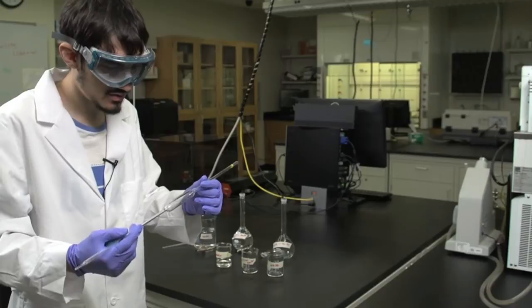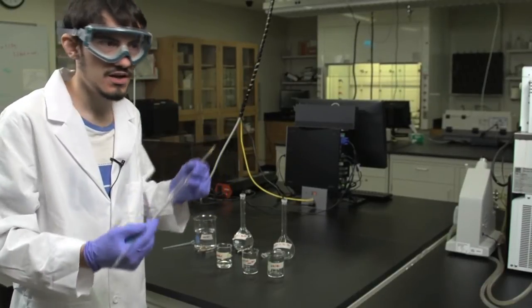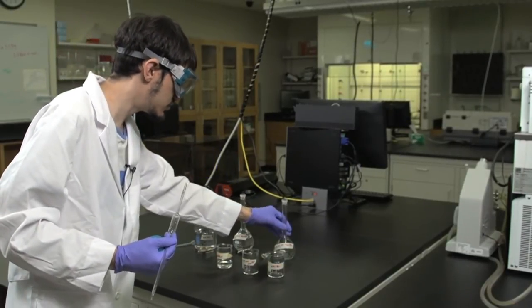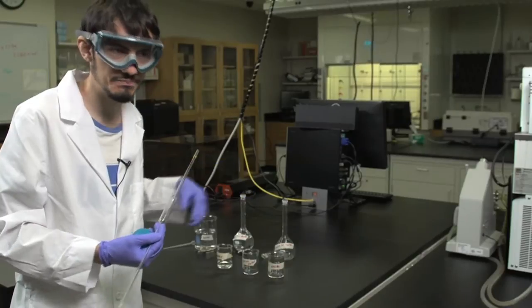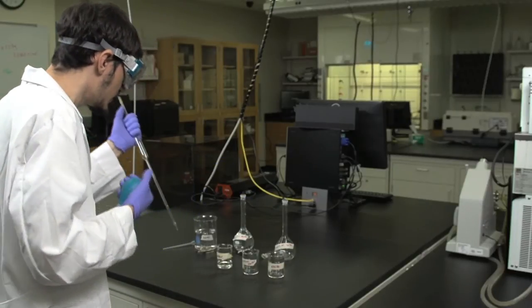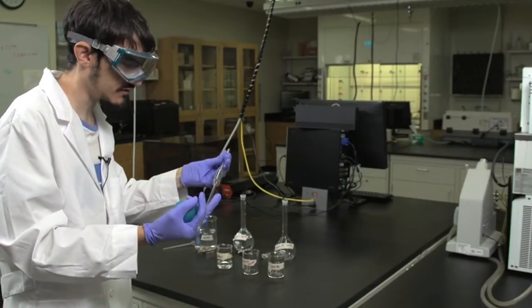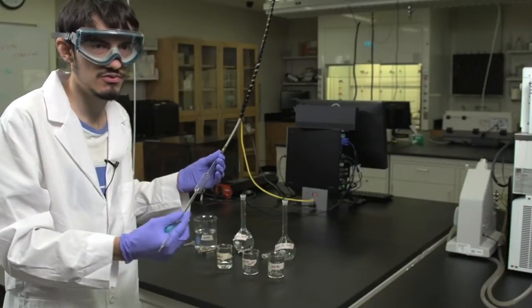In this segment, I'll be showing how to use a volumetric pipette and how to use it in order to create a diluted solution. First, you want to make sure that the volumetric pipette is adequately rinsed out with water.